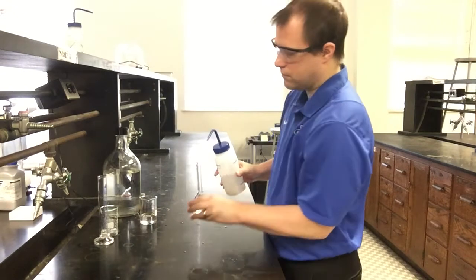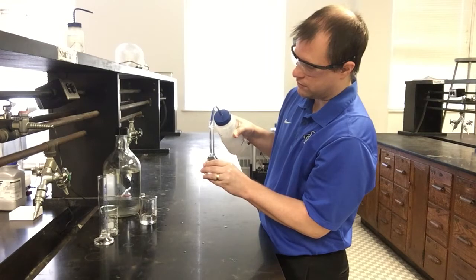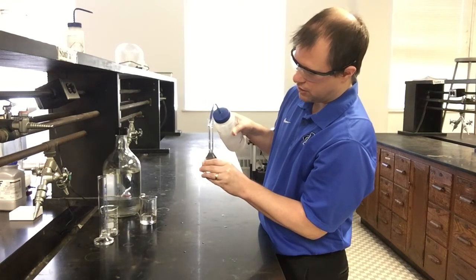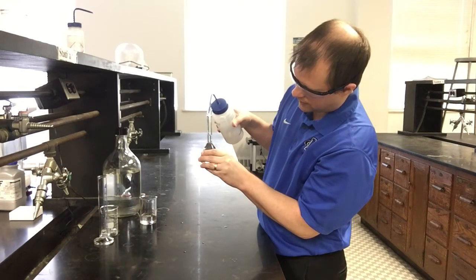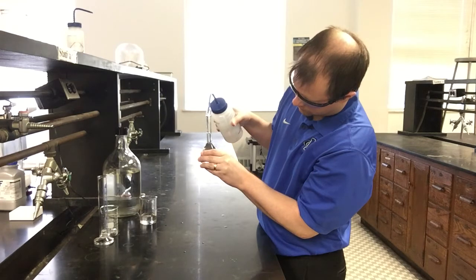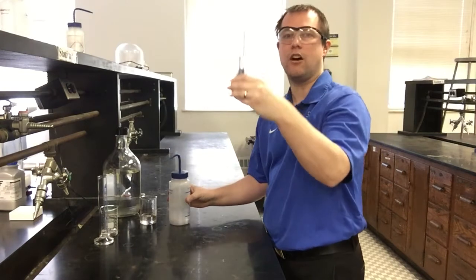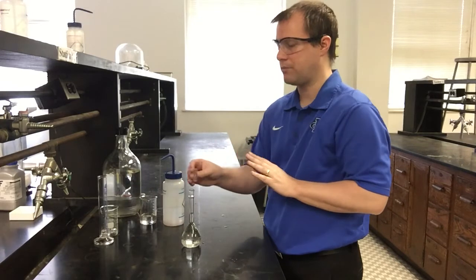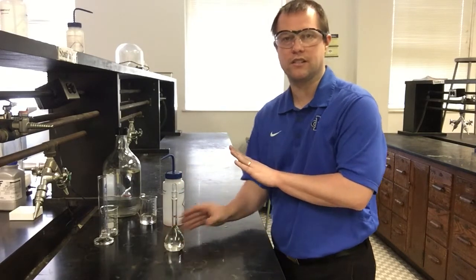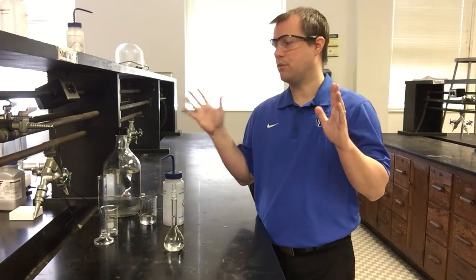And now I'm just going to take my deionized water again from my squirt bottle. I'm just going to slowly add water until I get my solution all the way up exactly to that line. So we'll slow down here and just very slowly add the last little bits. And now I have my solution, my meniscus sitting pretty much exactly on my line for my volumetric. So I now have both of my solutions prepped and ready to go. I have my solid calcium chloride that I dissolved. I have my stock sodium carbonate that I've now diluted to the right concentration and volume. And now we should be ready to actually do our precipitation reaction, which will be the next part.